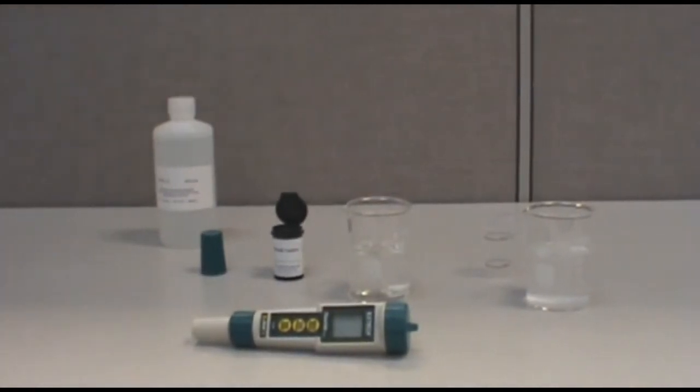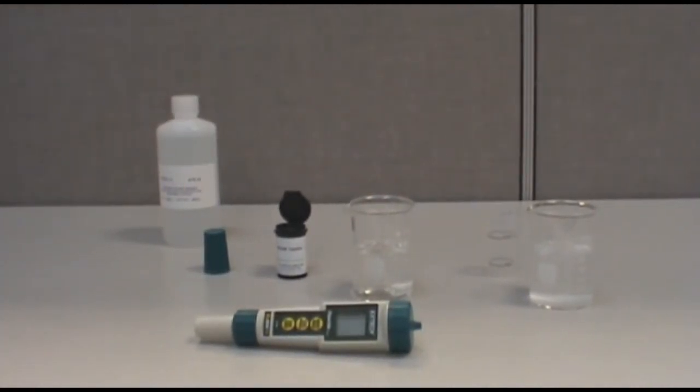To take a measurement, prepare your unknown solution by dissolving a reagent tablet in your sample. The sample we have chosen to measure is tap water.